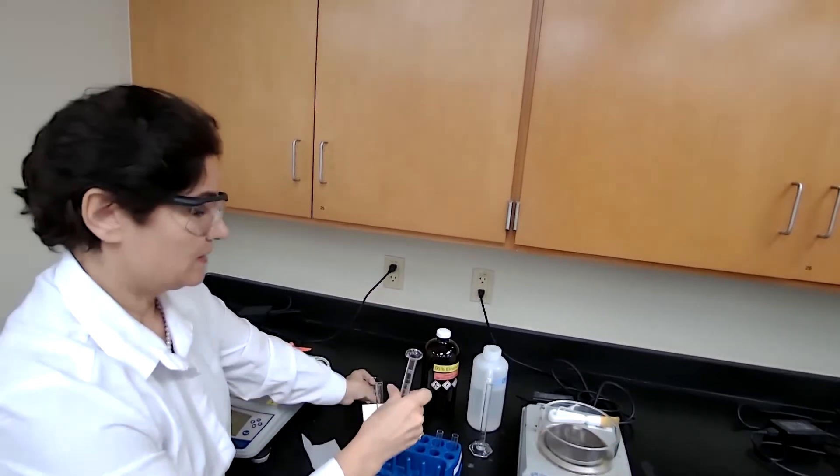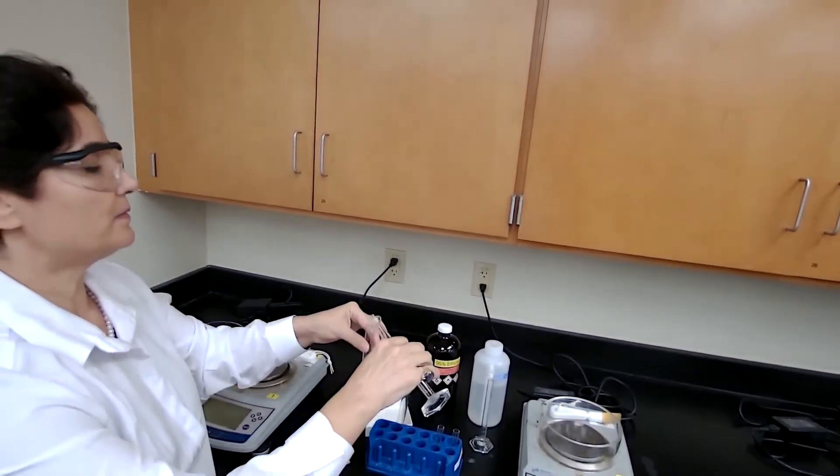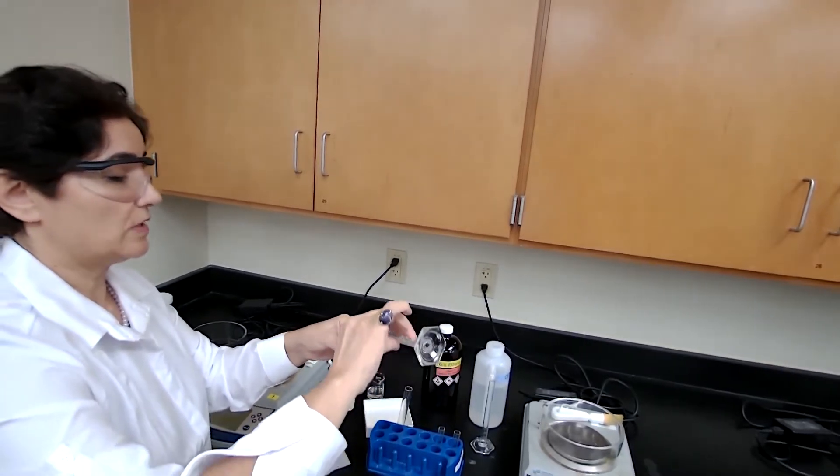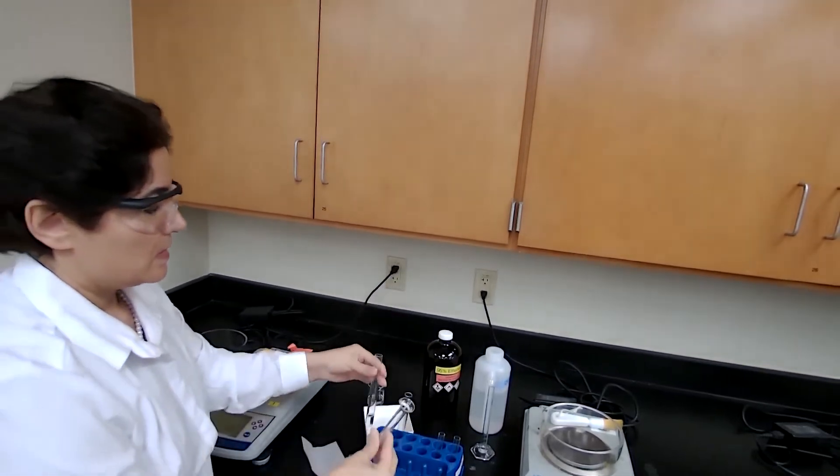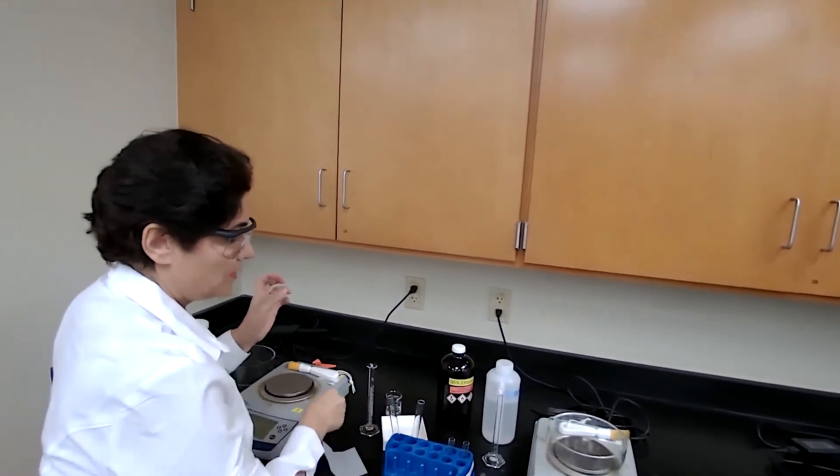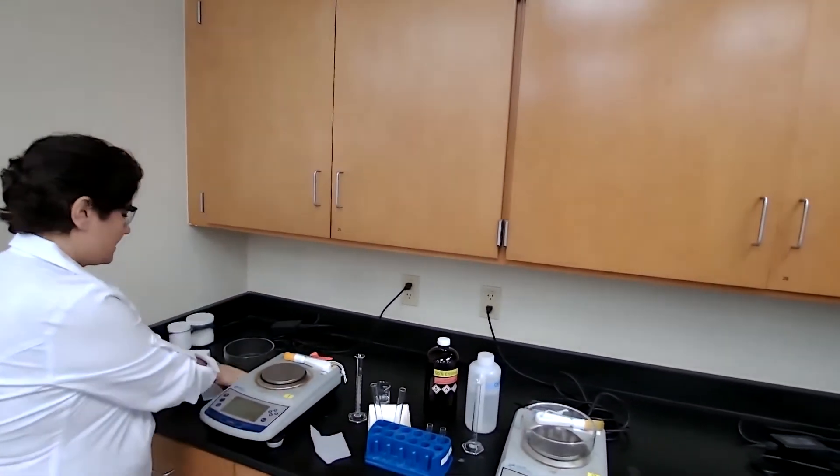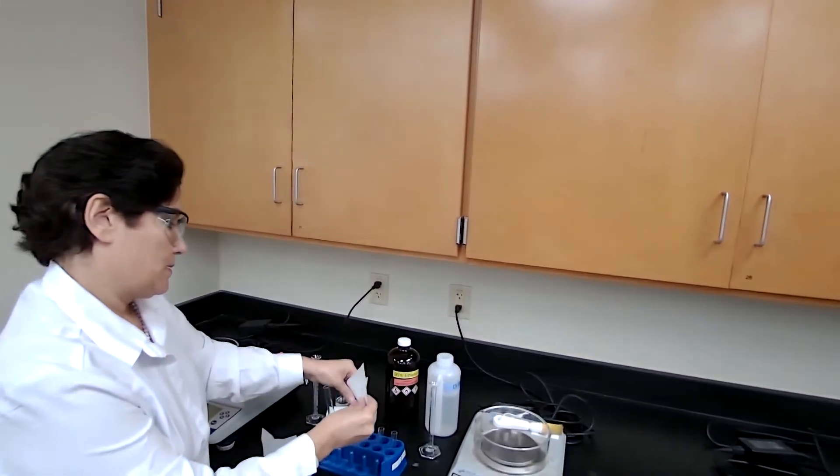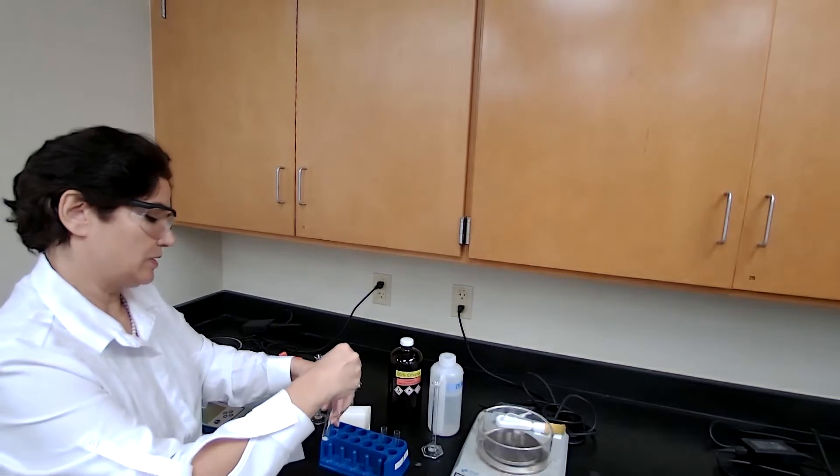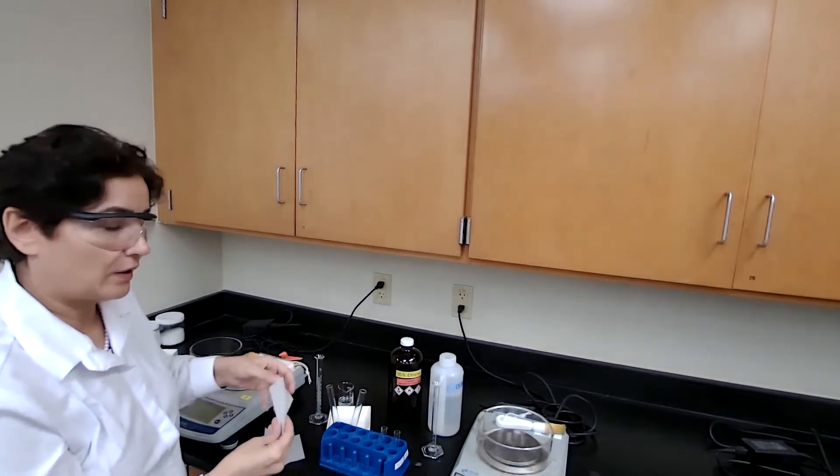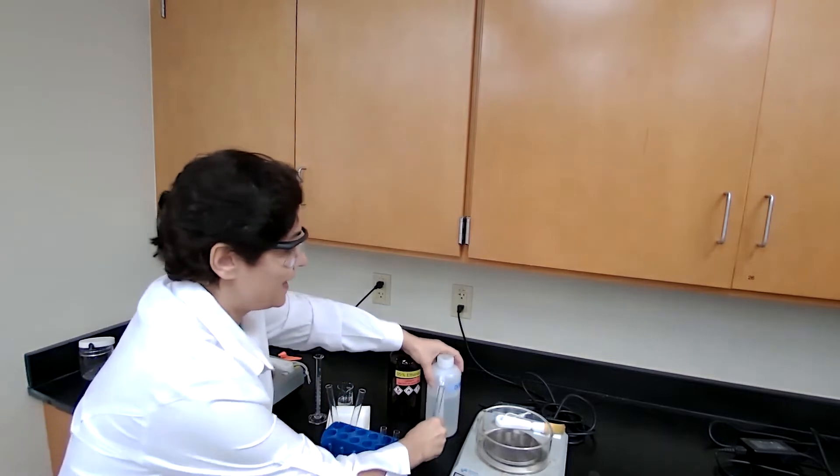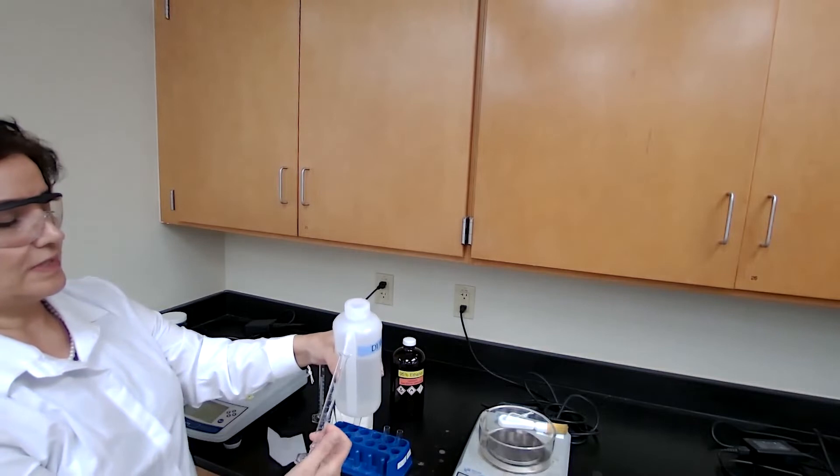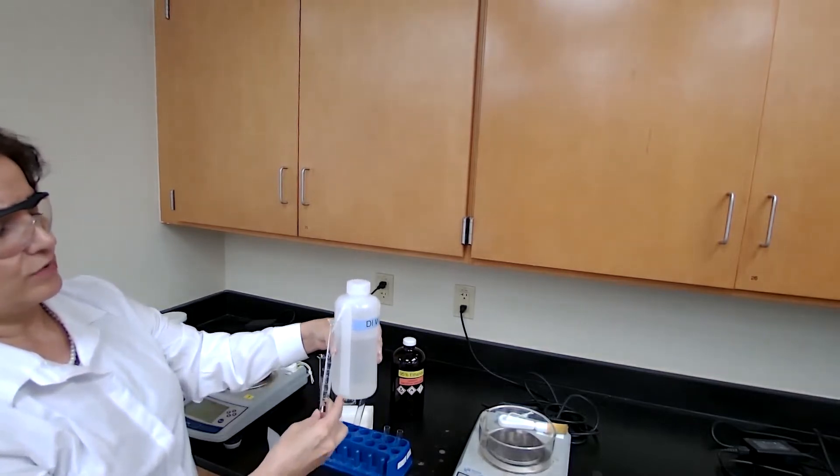If the solvent dissolves the sample at room temperature, it's not a good recrystallization solvent. If it doesn't dissolve at room temperature but does dissolve at the boiling point, it's meeting one condition. You have already seen all of this in the pre-lab discussion. I'm now testing to see if it dissolves at room temperature.